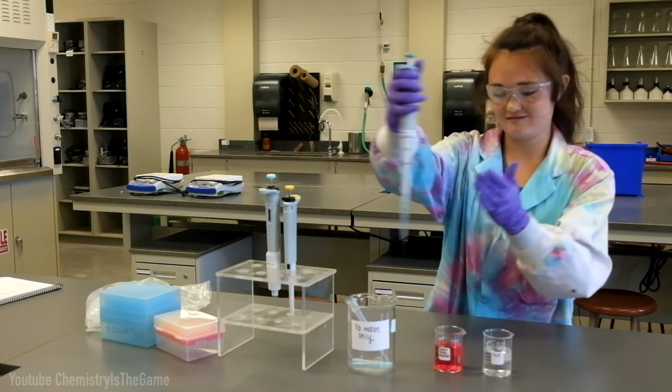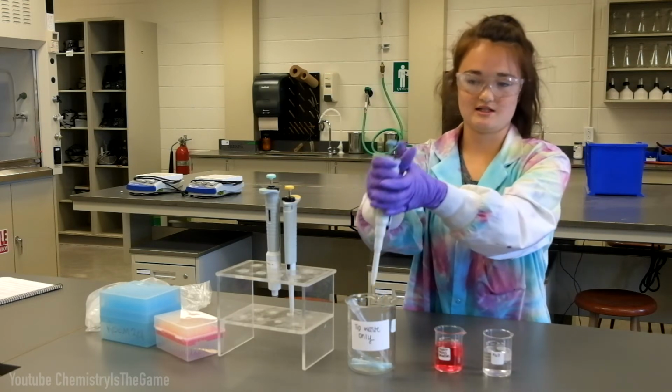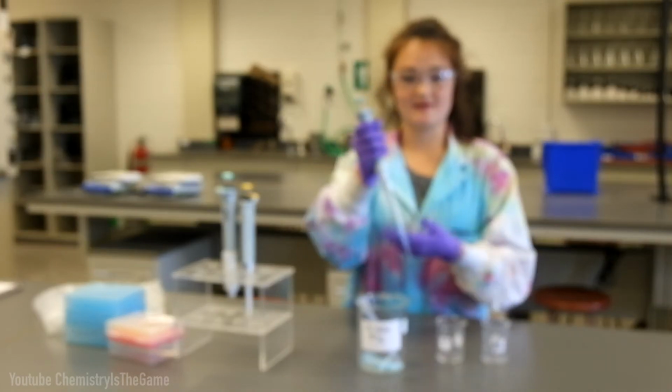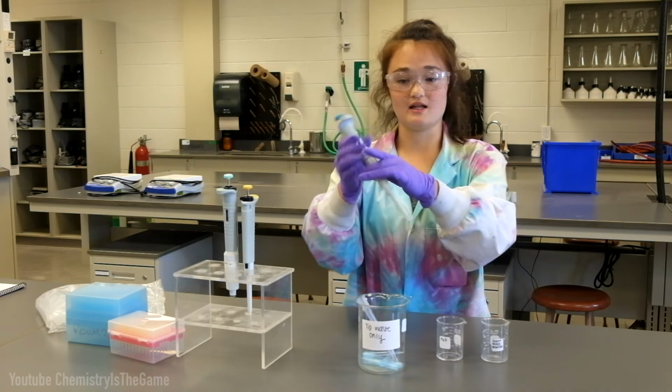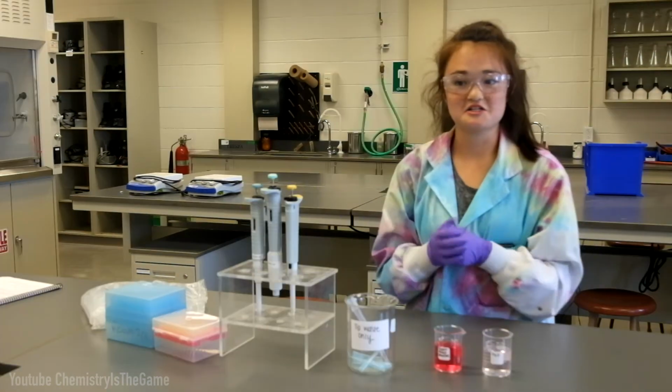And then once you're done, you press this back button here into the tip waste and put your pipetter back. Make sure you never leave a pipetter horizontal when you have a used tip. Always dispense of your tip first, and then if you need to, you can set it horizontally. And that's how to use a pipetter.